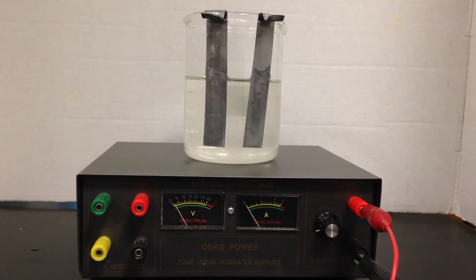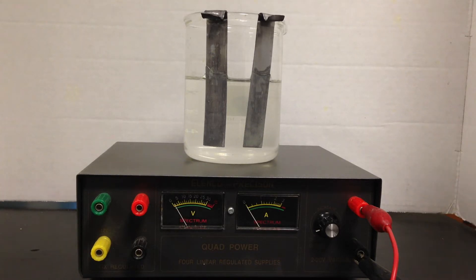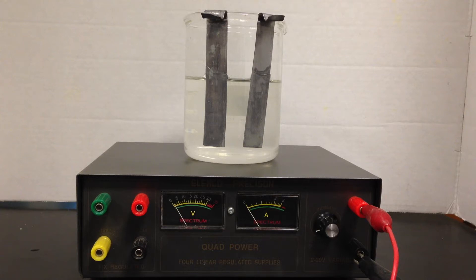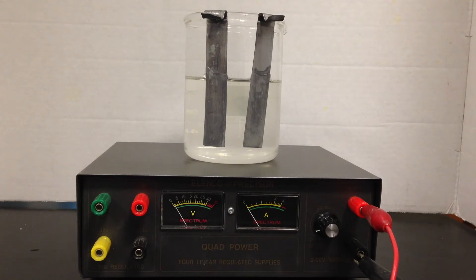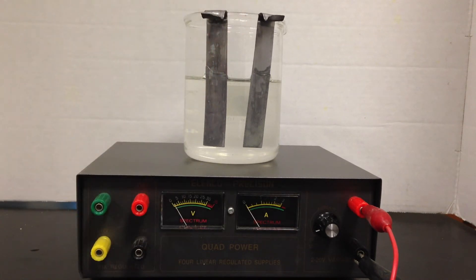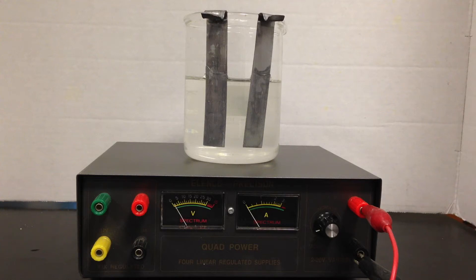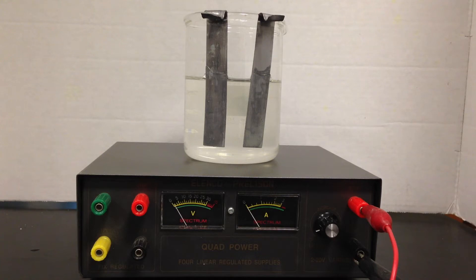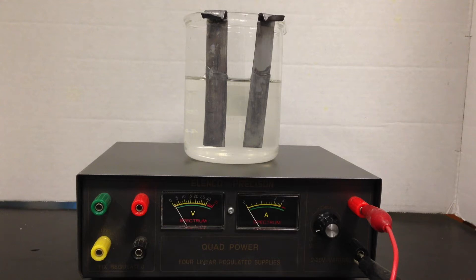This is one of my favorite electrolytic demonstrations. What I have here is two metal electrodes in a beaker of lead nitrate, and underneath this beaker is a DC power source. This is a non-spontaneous process, and I'm going to force the plating of lead onto lead — not very exciting, but it's a great demo to introduce electroplating and electrolysis.